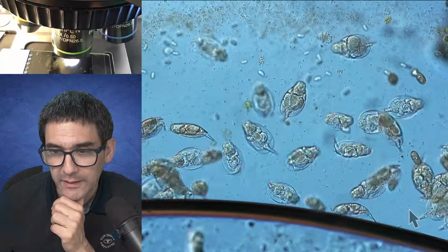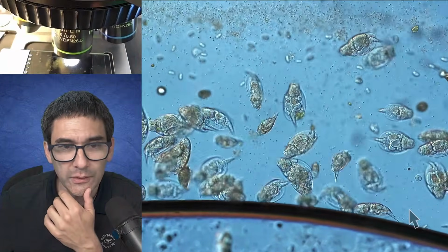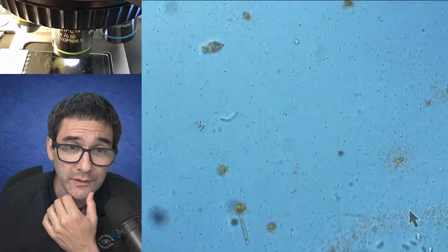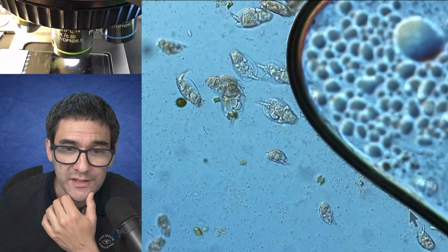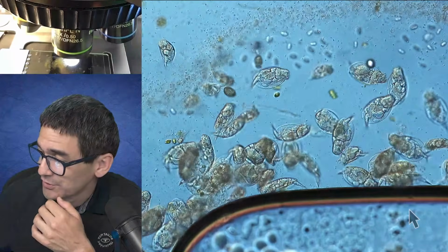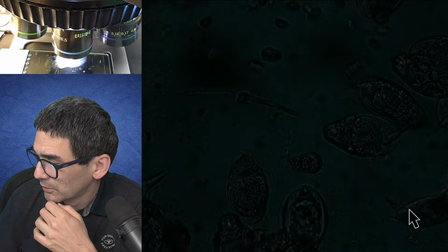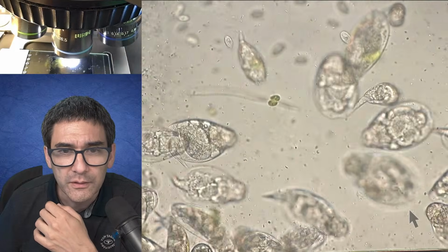The dark field effect, I get it. Look, this is a real feeding frenzy going on here. So it kind of means that sometimes it's not necessary to slow them down, because there are so many of them together that it's possible to directly observe them. So let's look. I'm going to put the DIC away. No, that's wrong. This one here. That's not bright field.